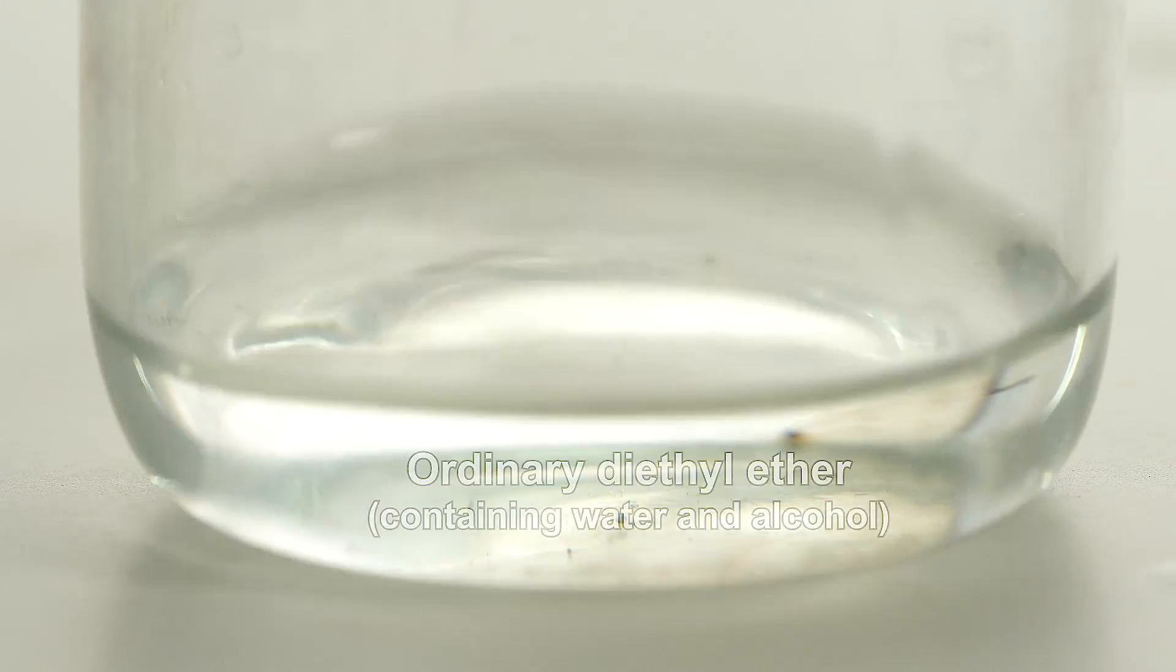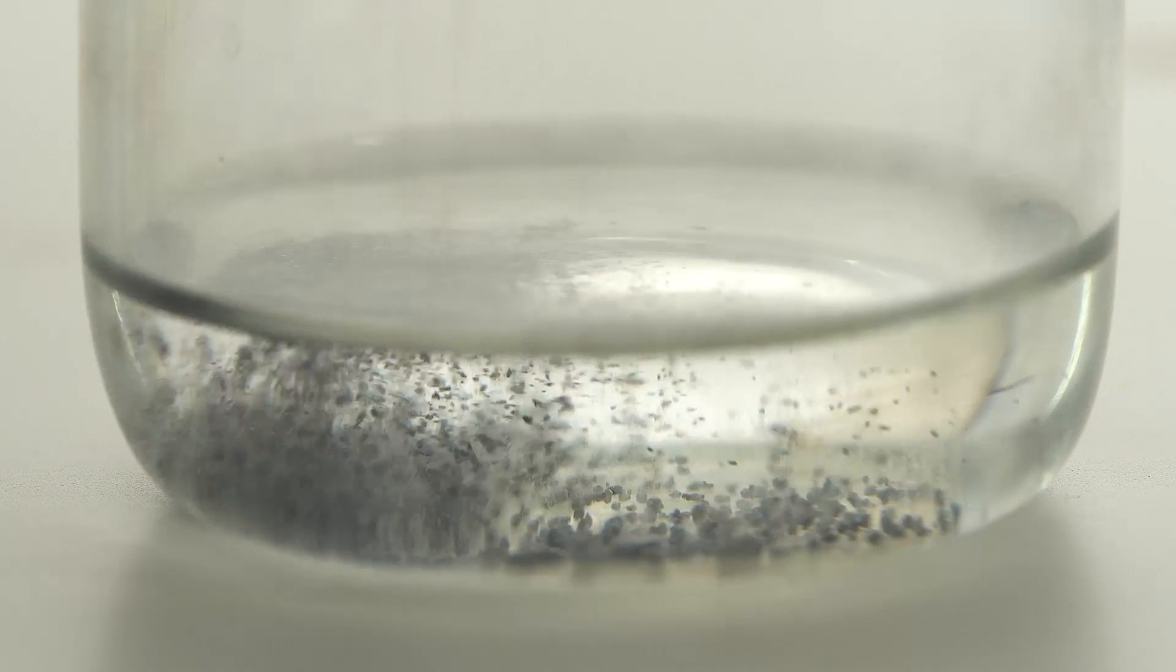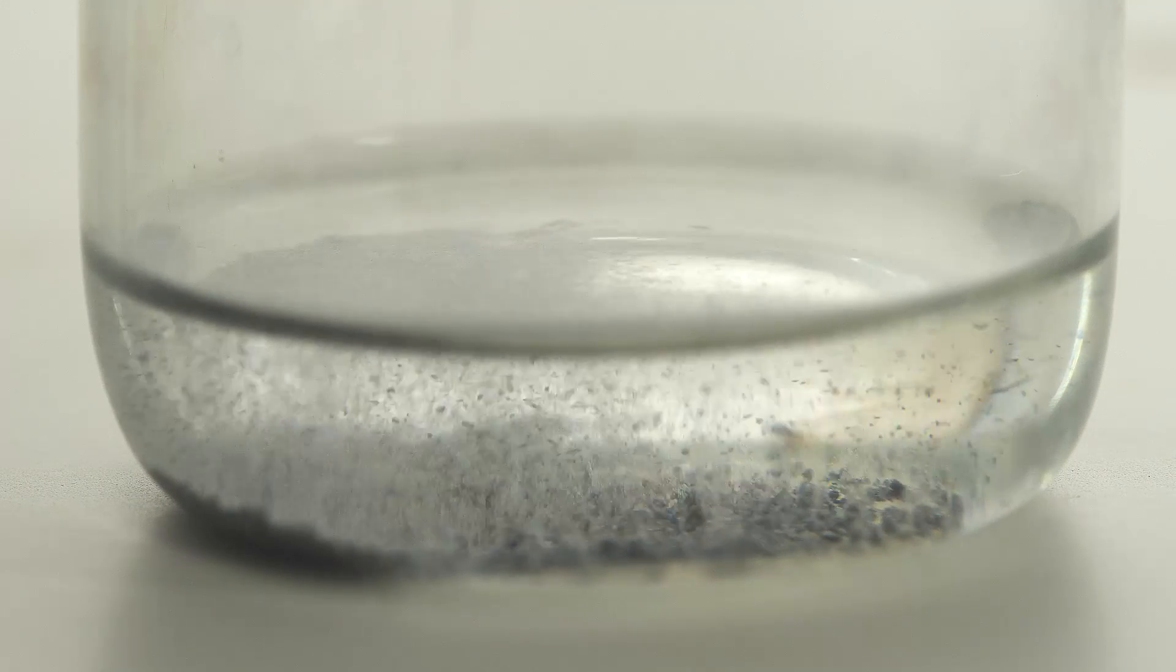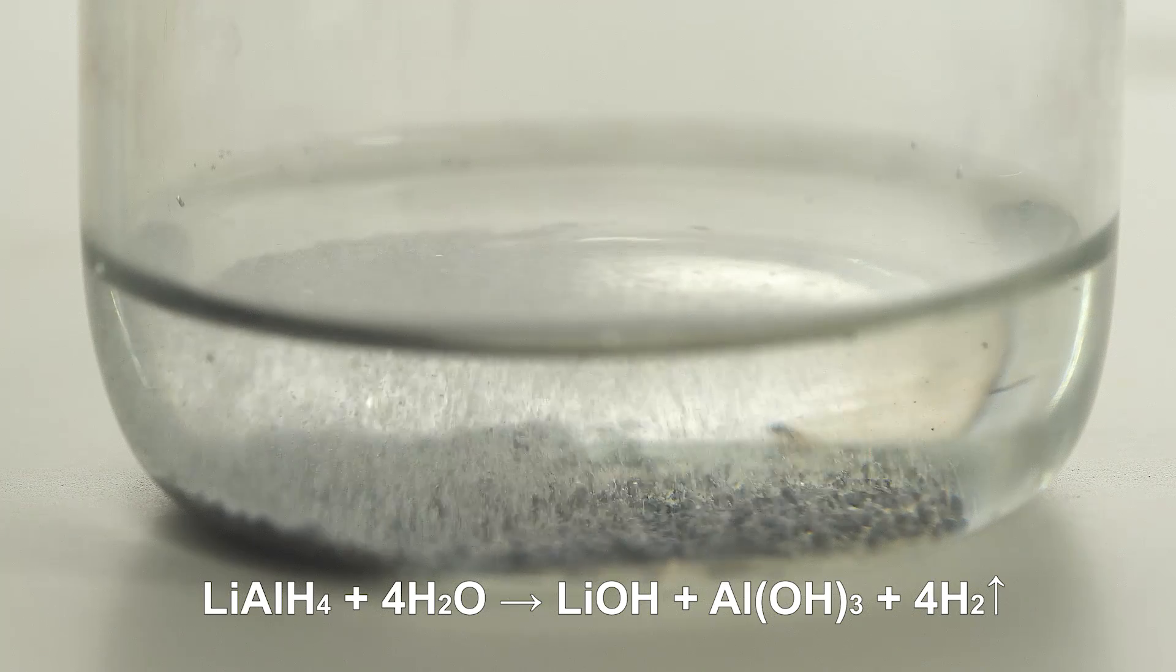As a comparison, I add some ordinary non-dried diethyl ether to lithium-aluminum hydride, and you can see gas bubbles appear right away. That means the reaction between the hydride and water occurs, resulting in the emission of hydrogen.